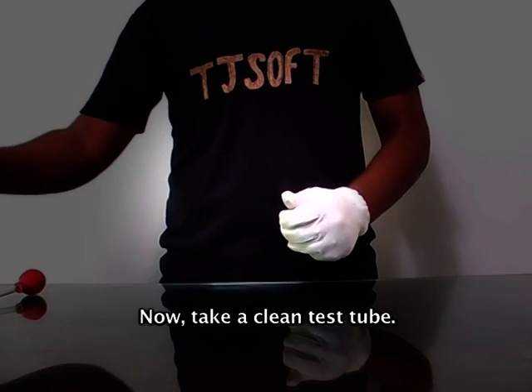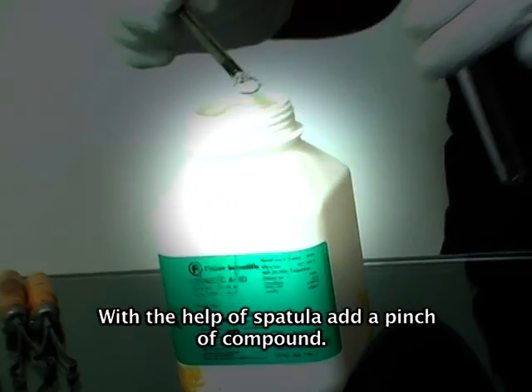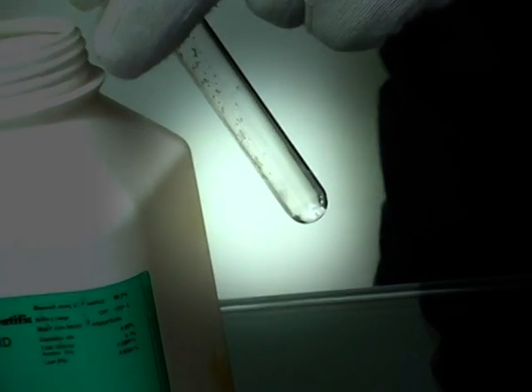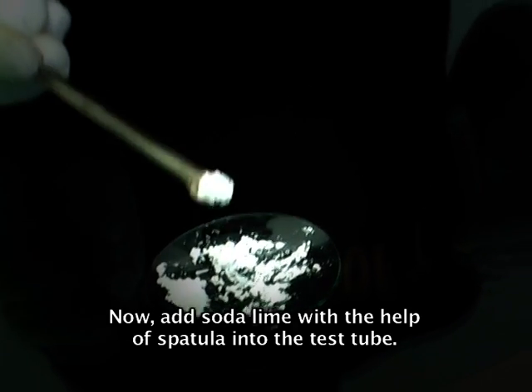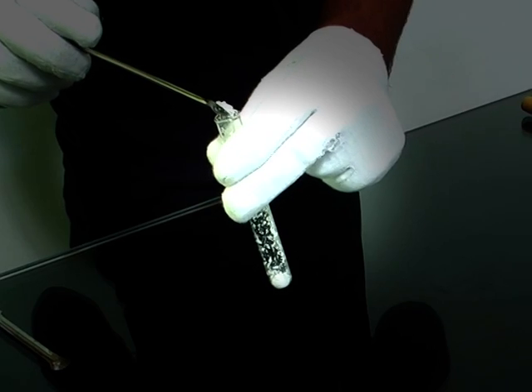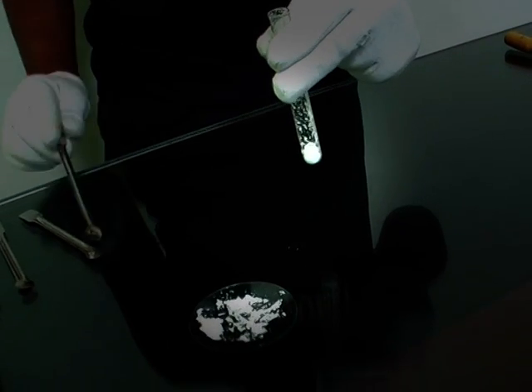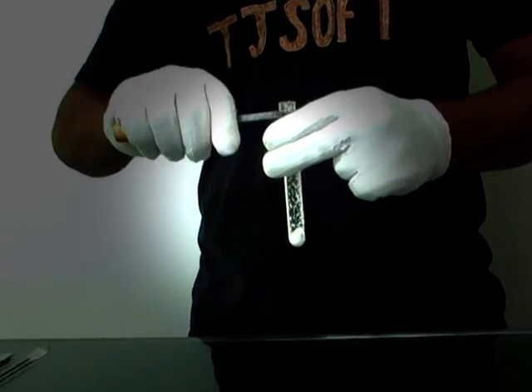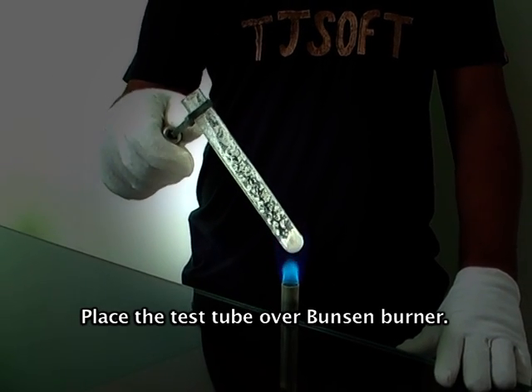Now take a clean test tube. With the help of a spatula, add a pinch of compound. Now add soda lime with the help of a spatula into the test tube. Hold it with a holder and place the test tube over the Bunsen burner.